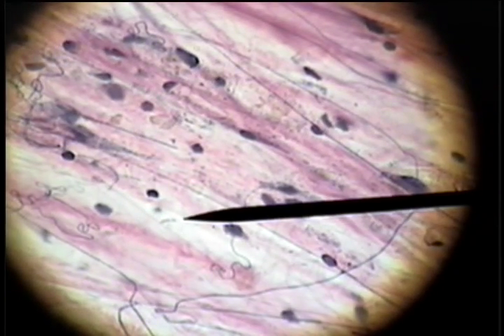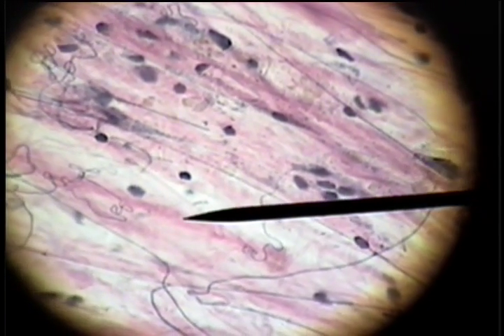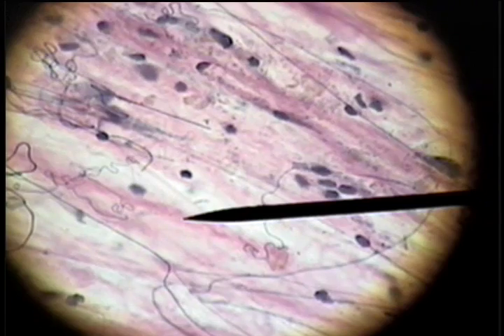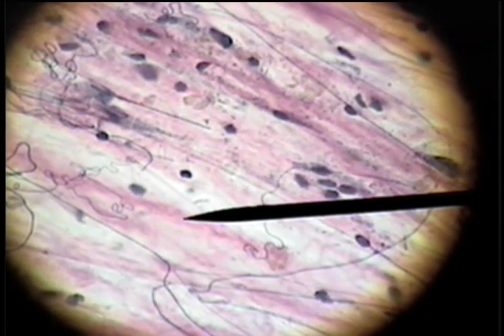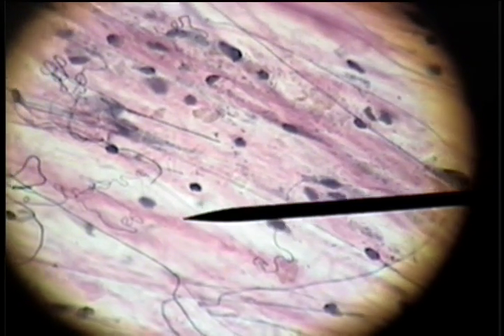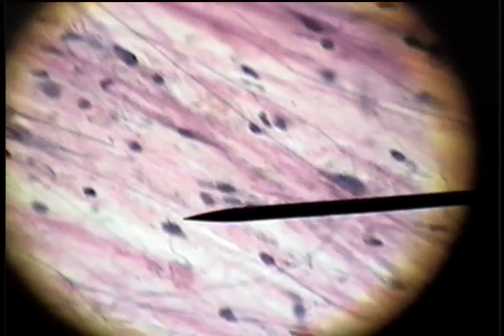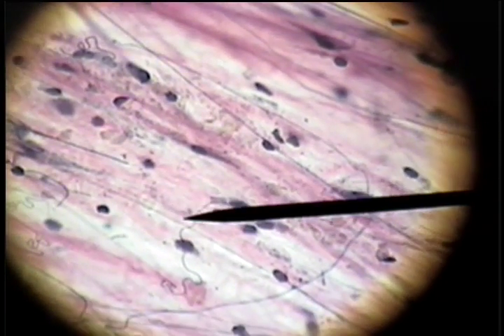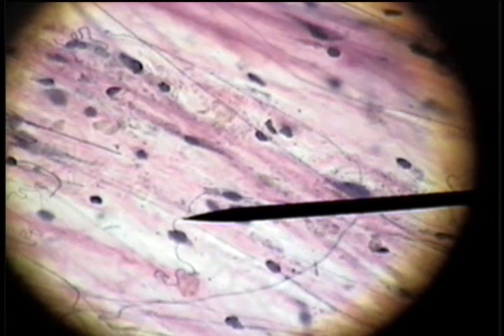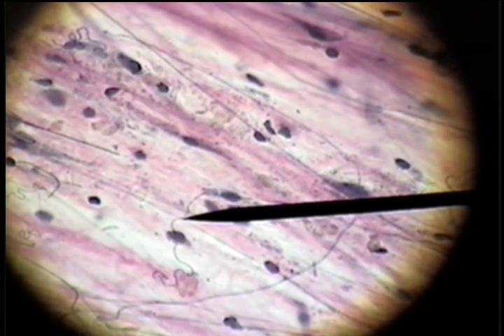If we switch to high power, we see the dark pink collagenous connective tissue fibers, and these dark, thin lines are the elastic fibers.